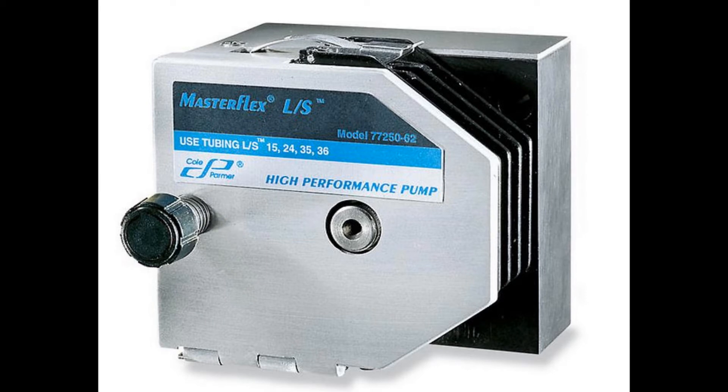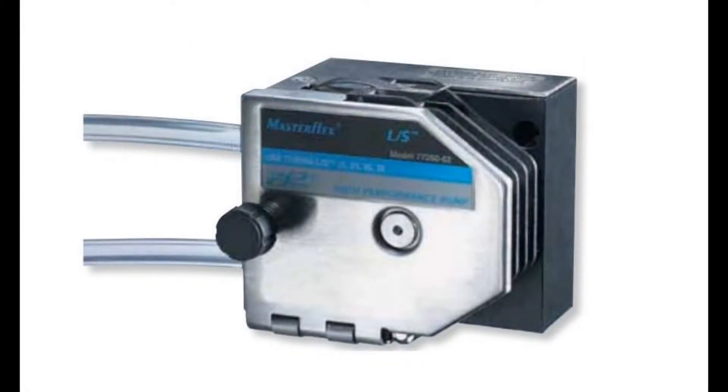Today we will be showing you how to properly mount a MasterFlex LS high-performance pump head and how to properly install your tubing.